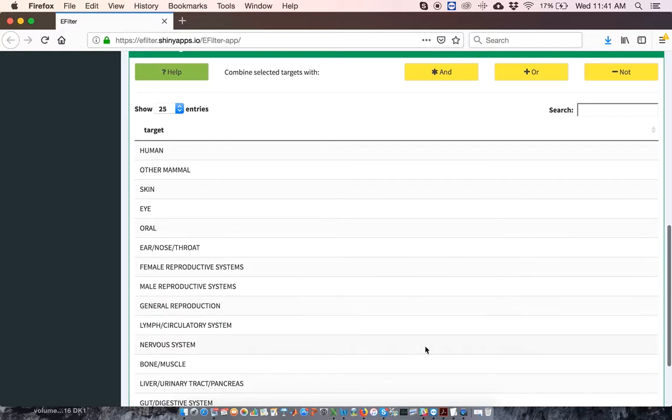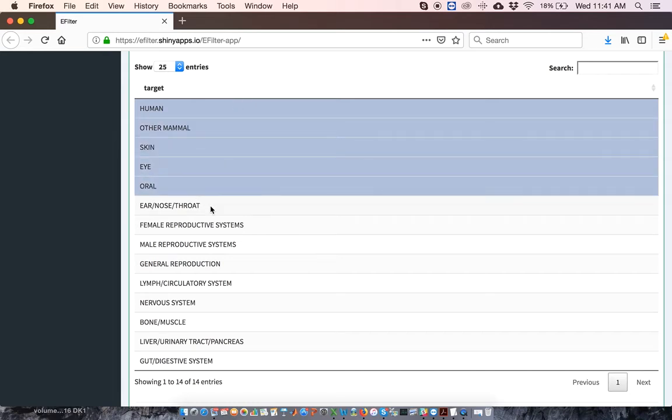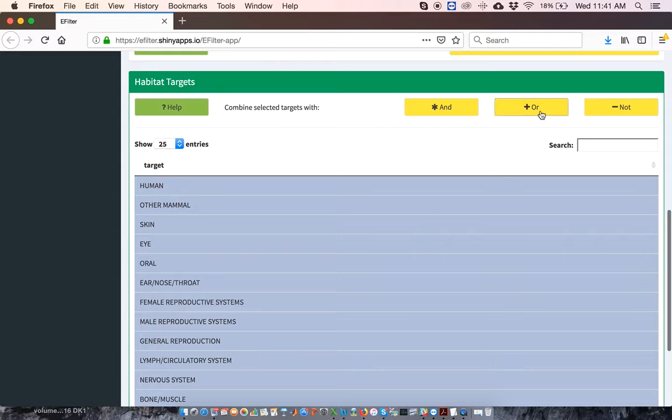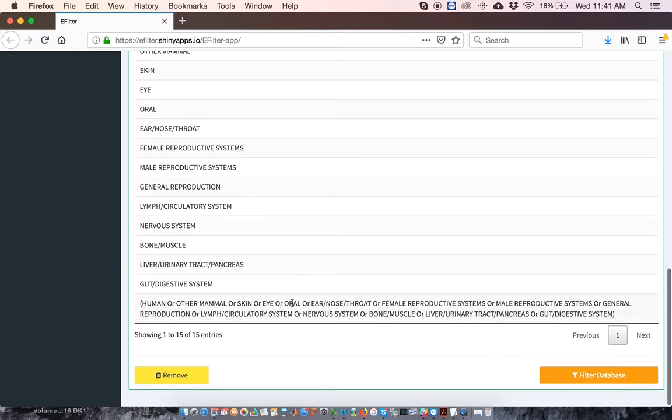This adds the habitats to the filter, but does not specify their logical combinations. To specify logical combinations, click on the habitats you want to combine. Here, for example, I want to combine all the habitats with OR. So, once I've selected all the habitats, I'll click the OR button. This creates a new filter with the chosen habitat combination. To use this filter, click on it. Then click the Filter Database button.